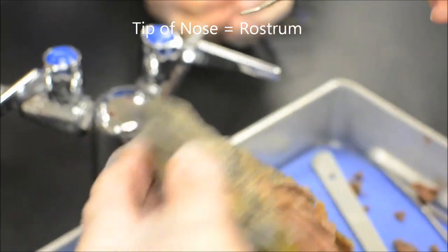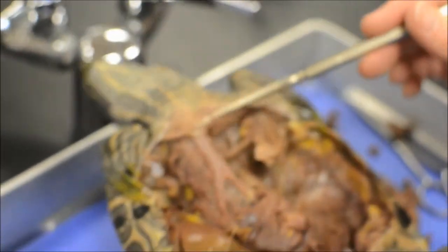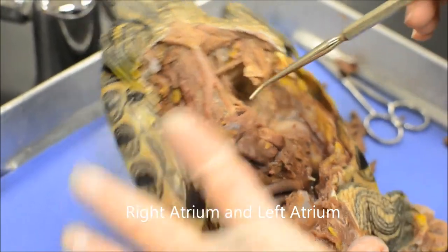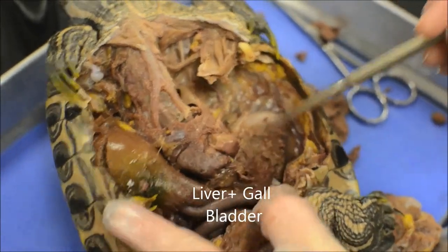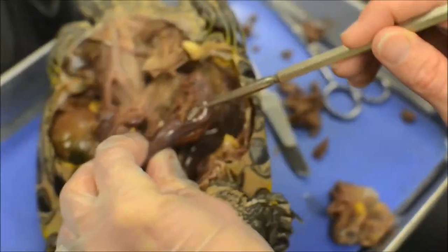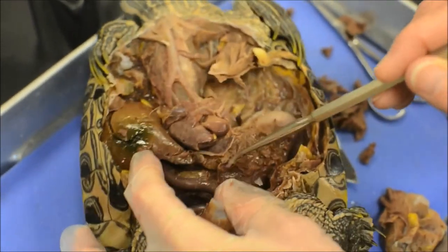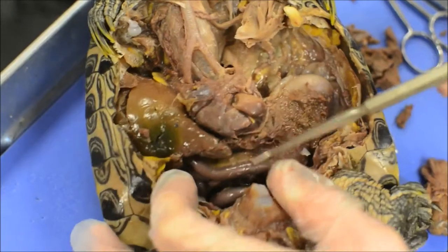You should be able to label the internal anatomy of a turtle on a worksheet similar to what you have. The tip of the nose is the rostrum, and on the side of the head this is the tympanic membrane. Here you have the trachea and the two bronchi. Here's the right atrium, left atrium, and ventricle. Here's the liver, and what's left of the liver, the gallbladder. Here's the stomach and then the first part of the small intestine, which is the duodenum. On top of the duodenum is the pancreas — it has an almost flatworm-looking shape.